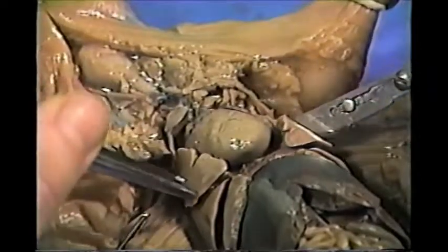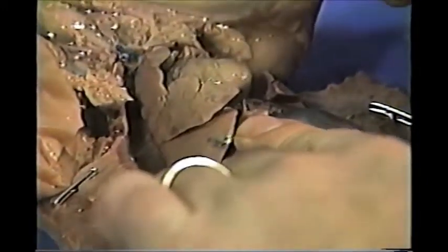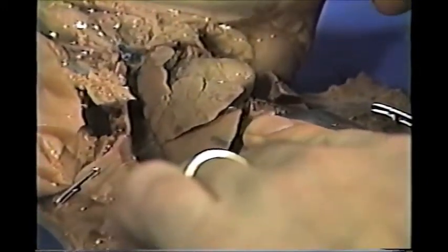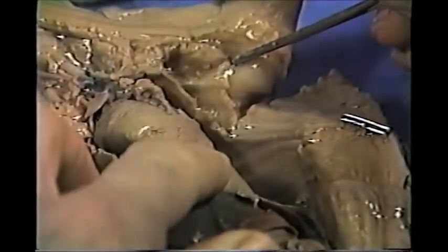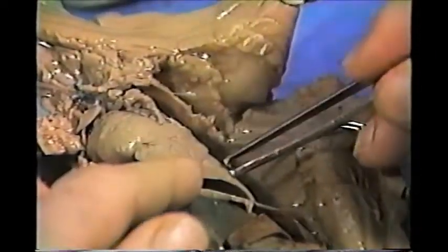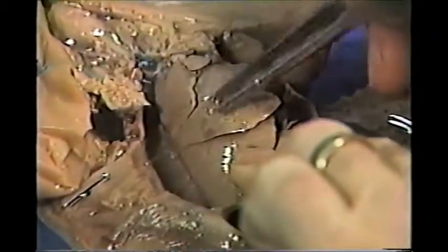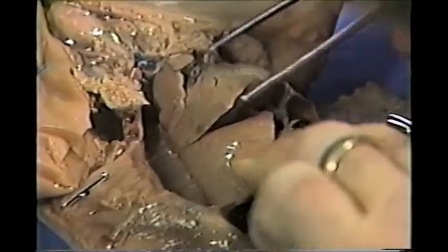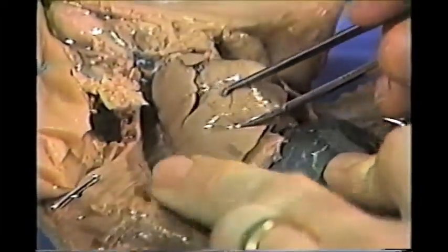On either side of the heart are the lungs. Now the fetal pig has 4 lobes on one side and 3 on the other, and I think it's 3 on the left and 4 on the right. These are the lobes. This would be 1 lobe, 2 lobes, 3 lobes, and I think there's another one deeper, which we're not going to be concerned with.